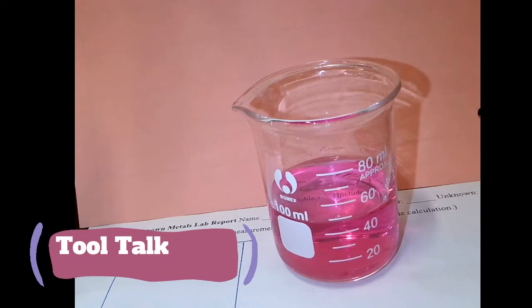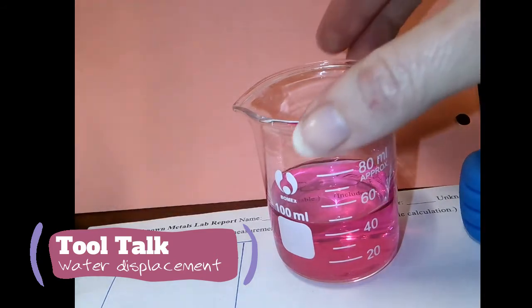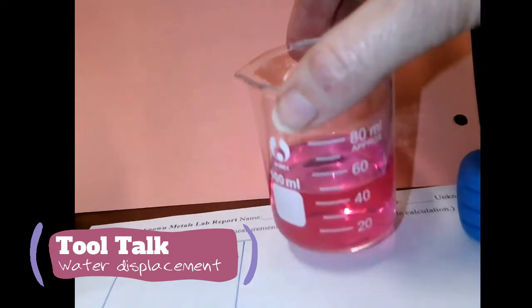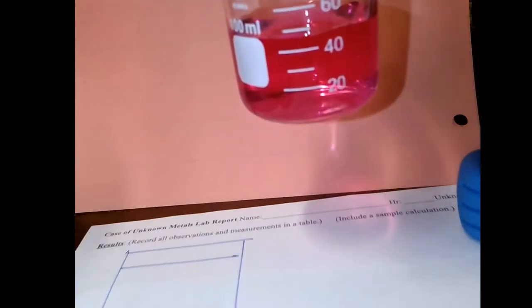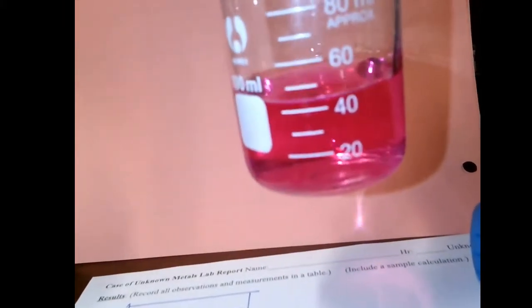And a quick little tool talk for you here as you head into using the equipment for this lab to get good results. This is a beaker, and you will notice that there are marks 20, 30, 40, 50, 60. Looking at significant digits and the rule for rounding here, you do want to make sure that you would be looking right at it at eye level. That doesn't work very well here, so I end up lifting it up just a little bit so that we can see where it falls.